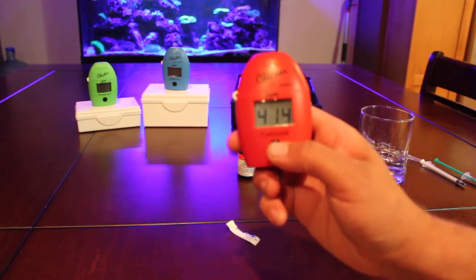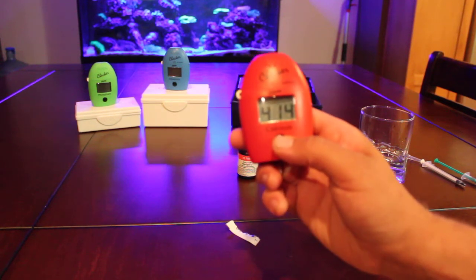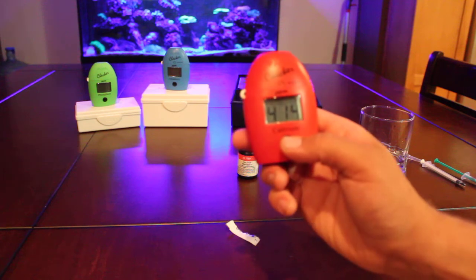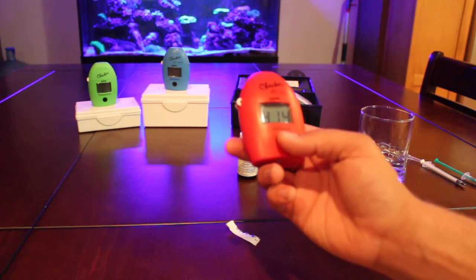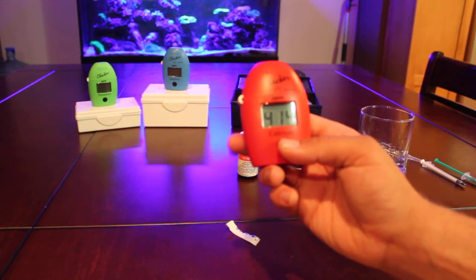Quick, easy, and precise. So I'm sitting at 414. It's way under where I'd like to be. I'd like to be about 450. But I did dose this morning, so it's nighttime now, and that's probably my daily usage.